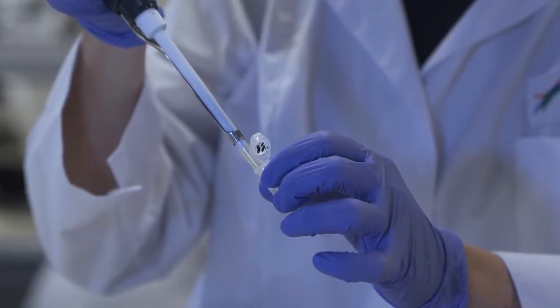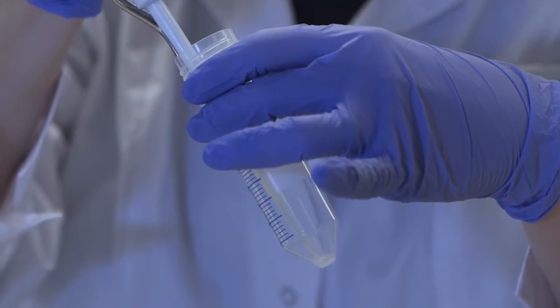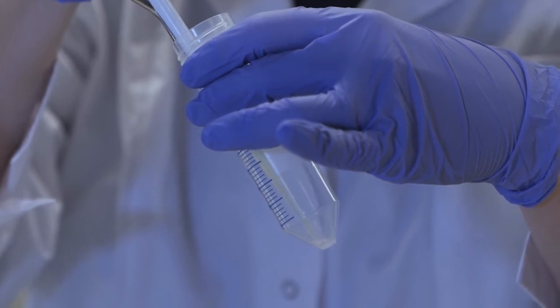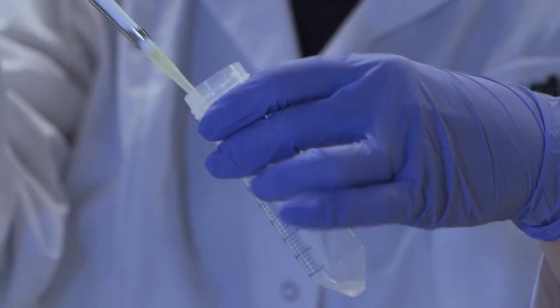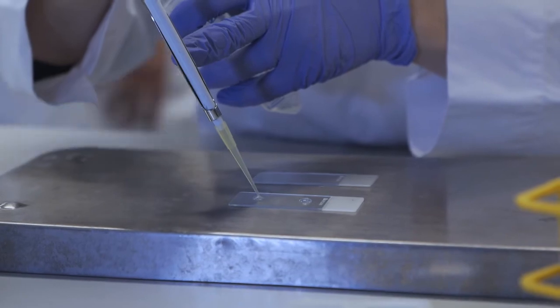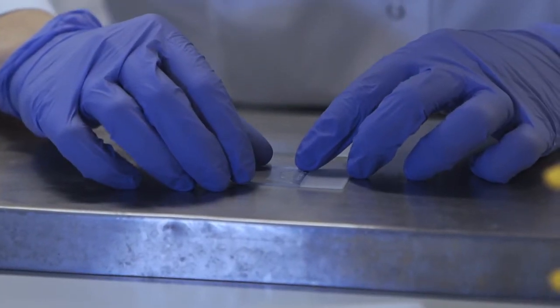If not, add directly the same amount of 1% low melting point agarose to a final concentration of 0.5%. This contains 10,000 to 50,000 cells per 75 microliters.